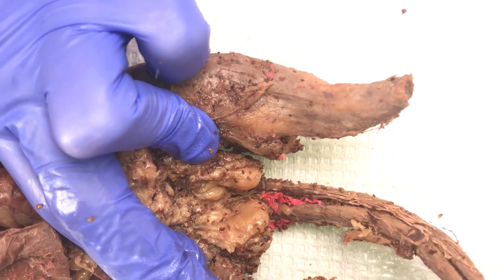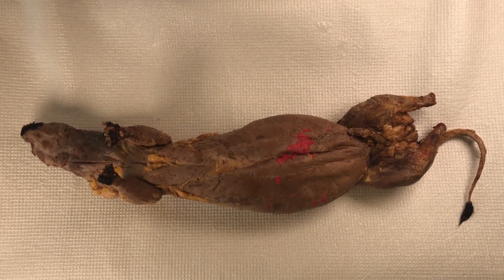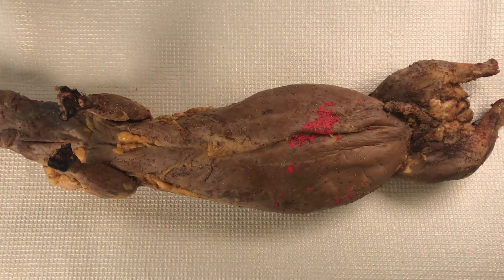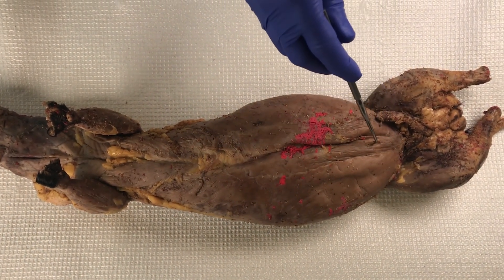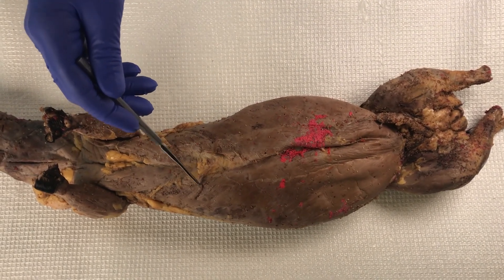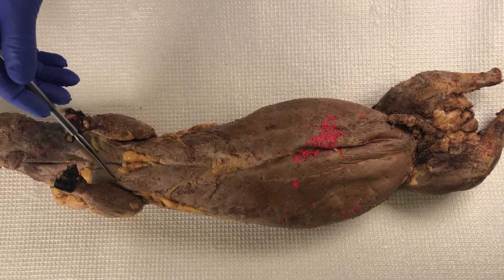Now to see the interior features, you need to make a series of incisions. Start by making cuts near the hind legs of the animal. Then make a cut up through the abdominal cavity and cuts by the rib cage to open that abdominal cavity. Then cut through the ribs to open the thoracic cavity.